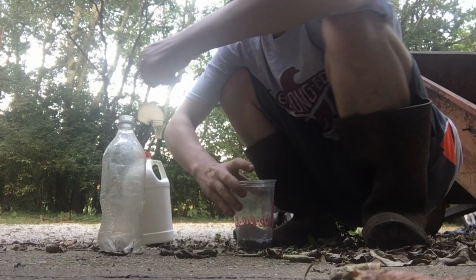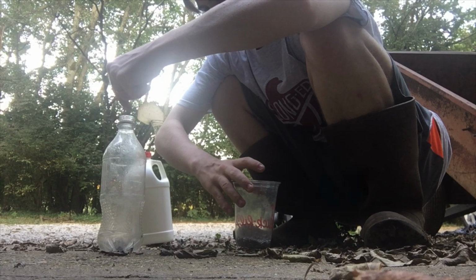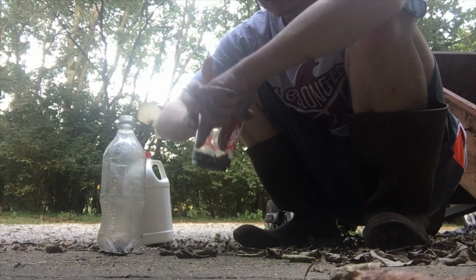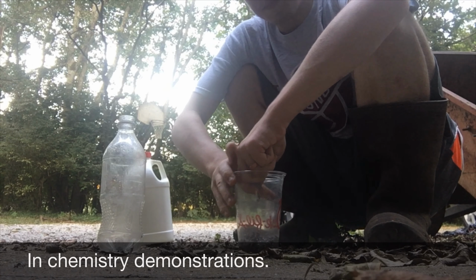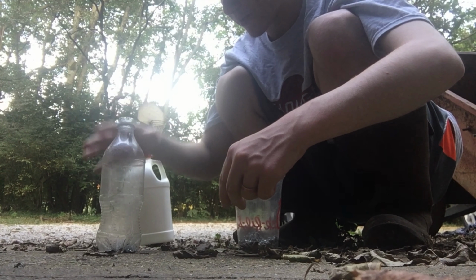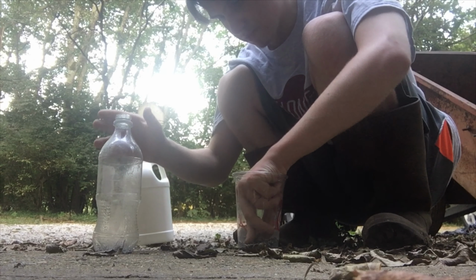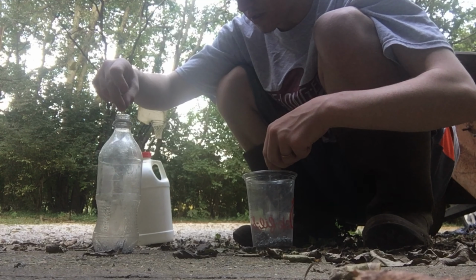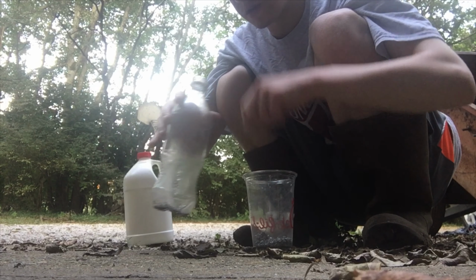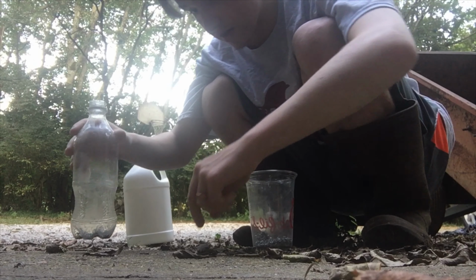This right here are zinc shavings, and with this I'm going to show you how zinc reacts with acids. Zinc is usually used to react with acids. For right now, we just have some zinc shavings in here. I think we can put just a few more in there. These are all shavings from the ring I made earlier. That video should have gone up just very recently.